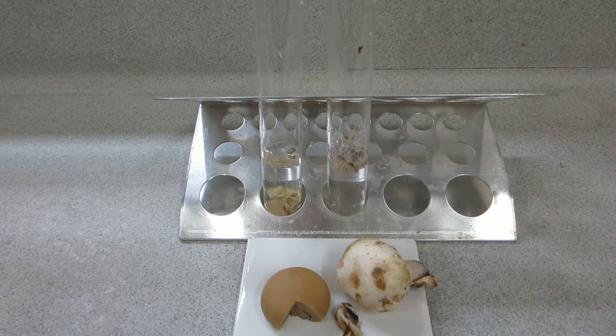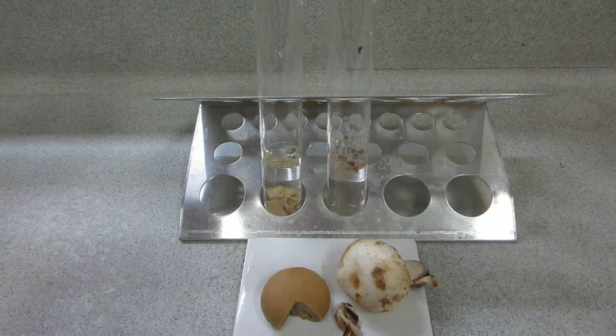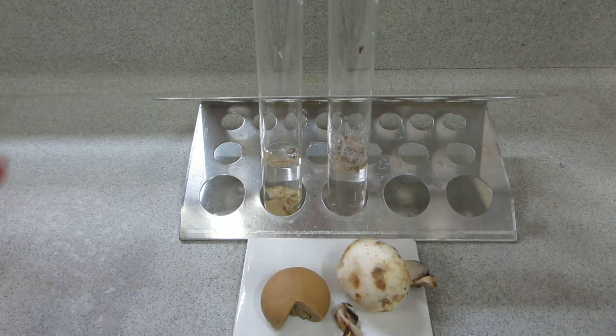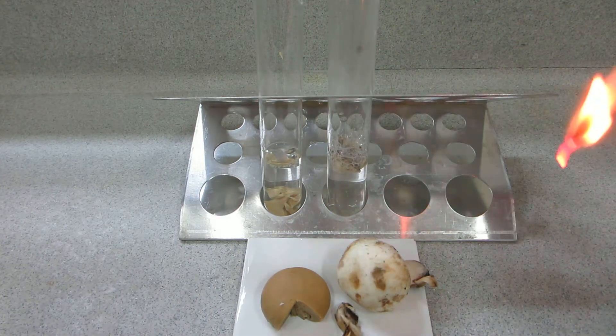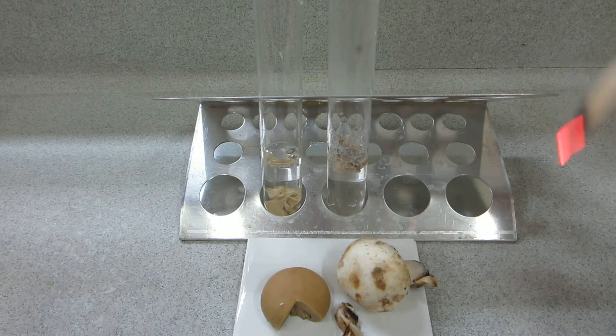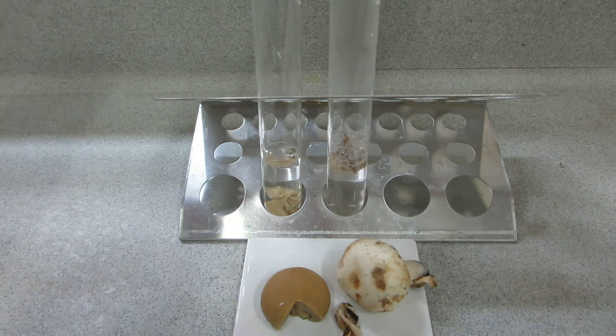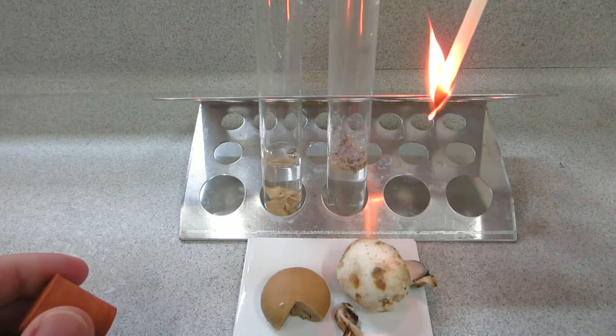And of course the final part of the test is to do a glowing splint test to see if we can re-light the splint. See if we can do that again. There's the glowing splint and it re-lights.